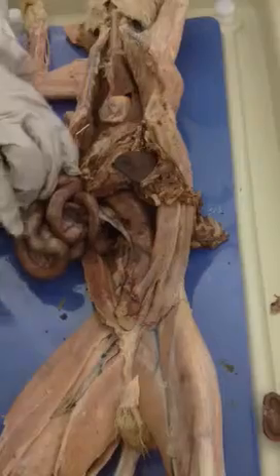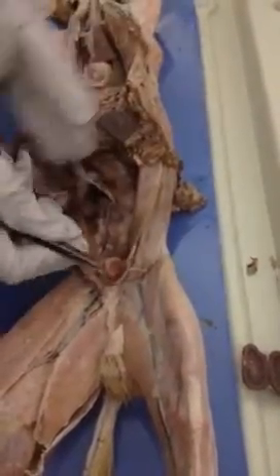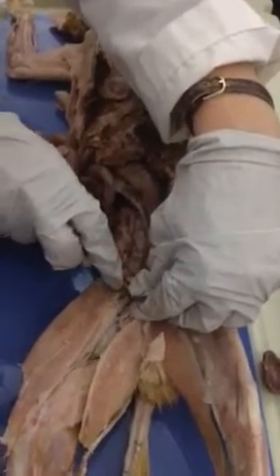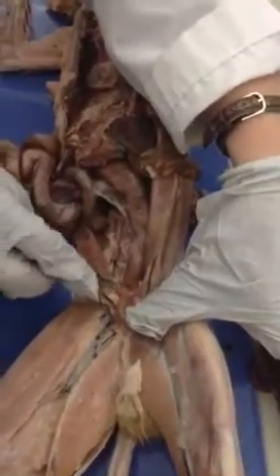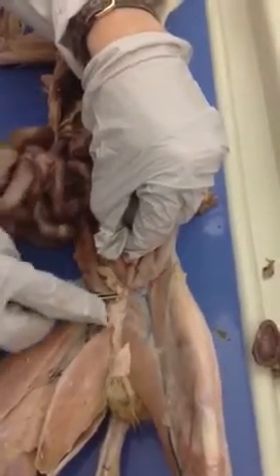Oh, wow. Okay, for the urinary structures, we have the urinary bladder. Make sure you don't put just bladder, because we have another bladder, which is the gallbladder. So the urinary bladder has to be all there. If we pull on the urinary bladder, you should see a little bit of movement down here. I need to clean this up. Okay, so there are these two tubes that come off the urinary bladder here and here. Actually, they come to it, and those are the ureters. And then there's a tube that goes away on the front, and that's going to be the urethra.